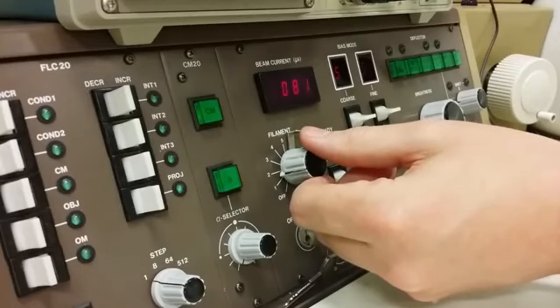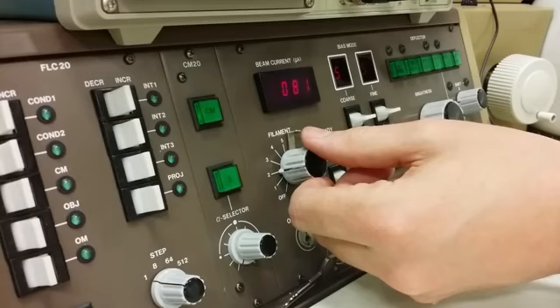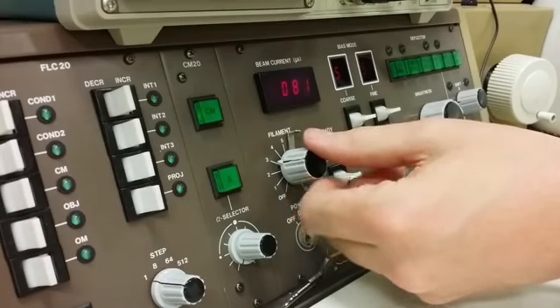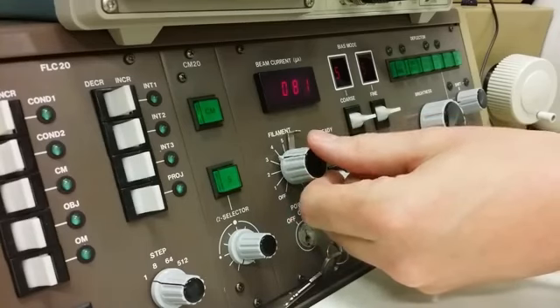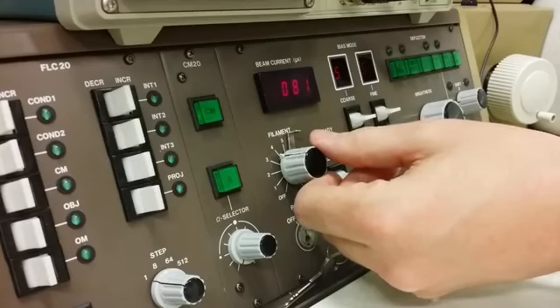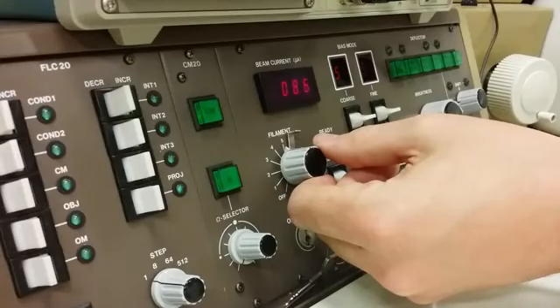The next thing is to turn on the filament. We do that by turning on the filament knob. And here it is important, depending on what kind of source you have for the electrons. If it is a basic tungsten filament, then you can turn this knob up all the way with a constant slow motion, half a minute of turning. If instead you have a LaB6 crystal filament unit, then you must heat that much more slowly, several minutes. Otherwise, if you heat it up too fast, the crystal might crack in its soldering against the filament wire.